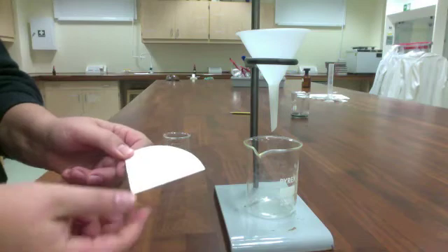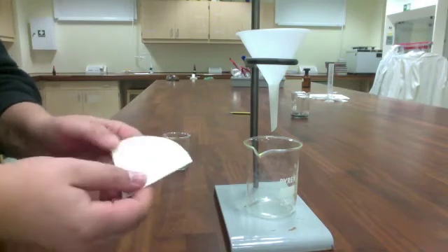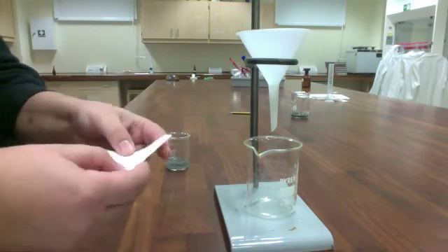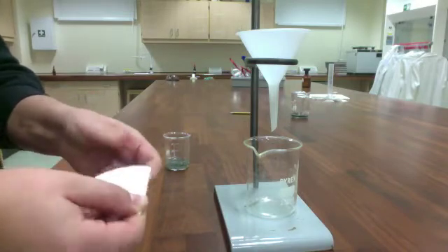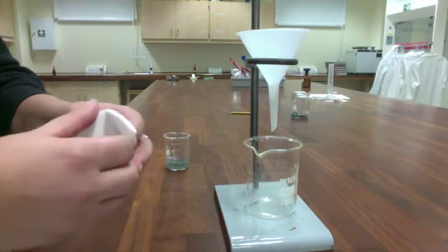Then we'll fold that in half again, so two times in half. And if you are feeling really adventurous, you could fold it in half a third time. Again, make those creases sharp, but don't use your nails.